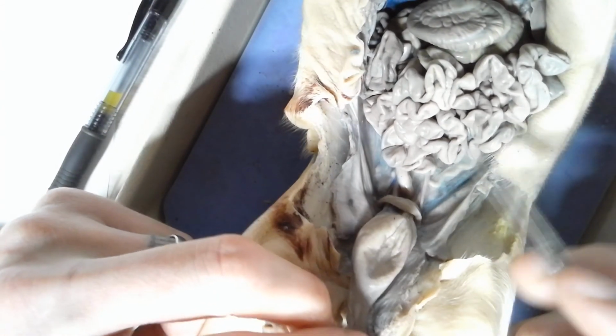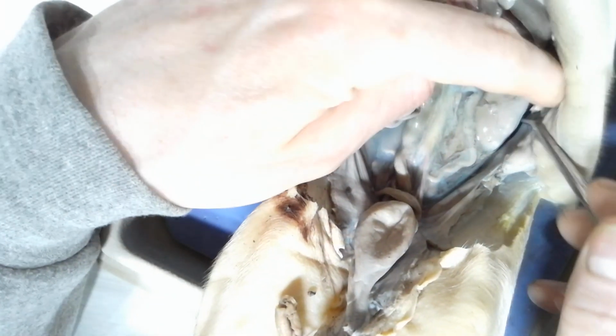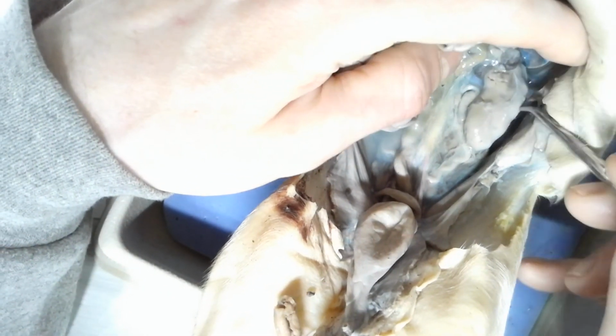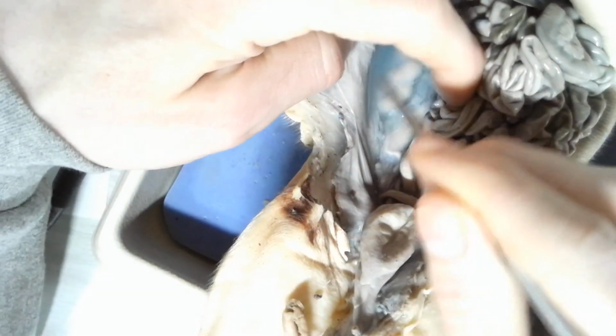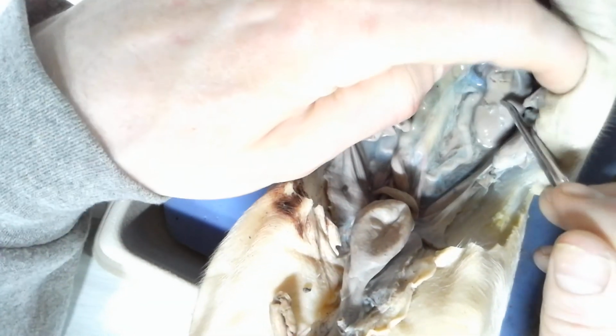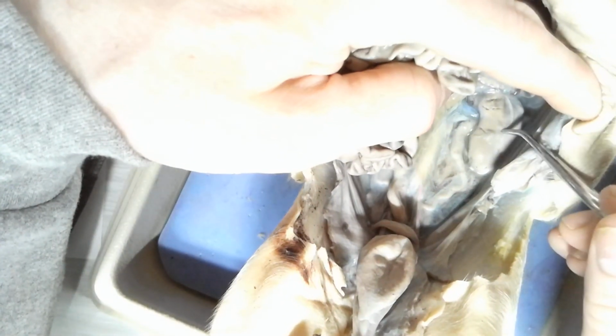Okay, where the bladder leads from are the urinary organs called the kidneys. So they're in the back of the wall here. So here's one kidney right here. Move the intestines over. You got the other kidney right here. So I'm going to focus on this one right here. So looking at this kidney right here. Okay, you see the kidney itself.